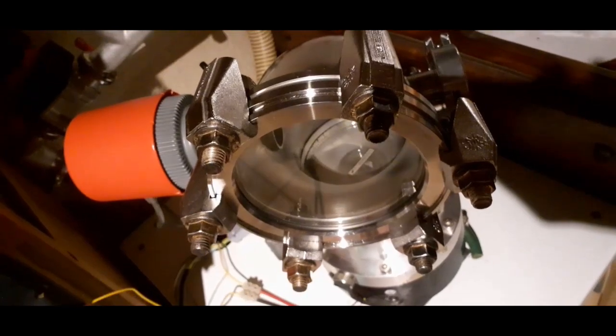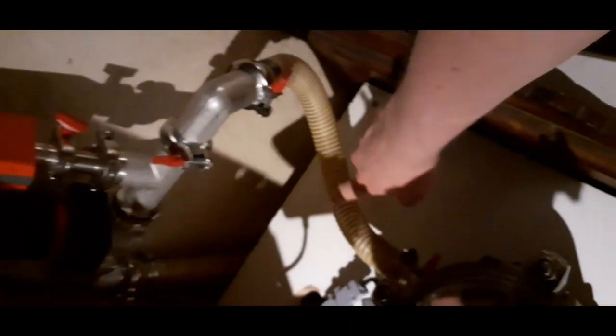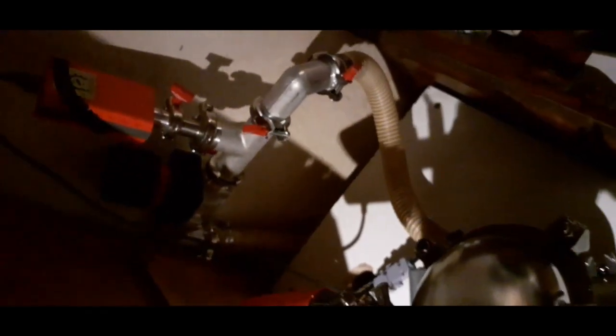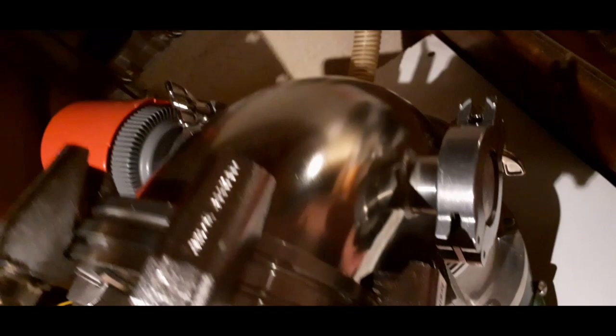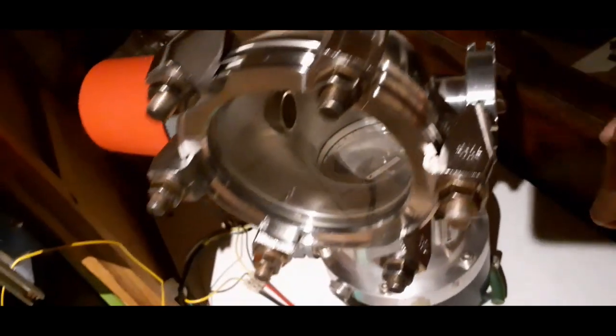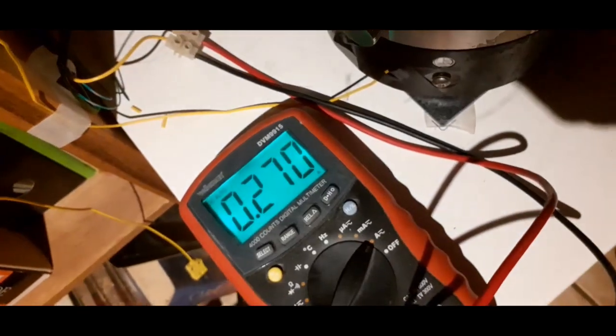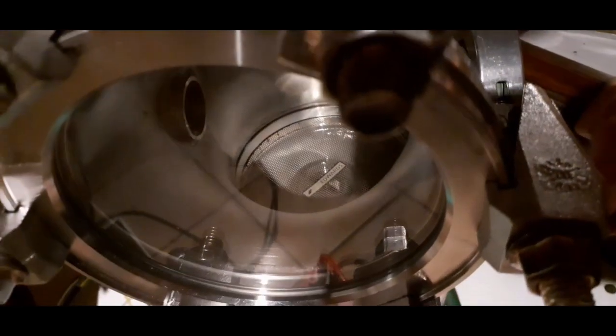Now it does make a bit of a racket, this turbo. I've tried to reduce that by decoupling the input manifold here, the foreline, with some flexible hose so it doesn't sit and act as a tuning fork. And I've tried to put some gel tape underneath it to decouple it. It helped a lot. Before, it was so loud that it deafened out the foreline pump, but it still has a sound. I think that's just the normal operating sound. It doesn't change in pitch, and normally you have to be a bit worried when turbos make a sound, but of course they're never silent, so I think this is pretty much just fine.